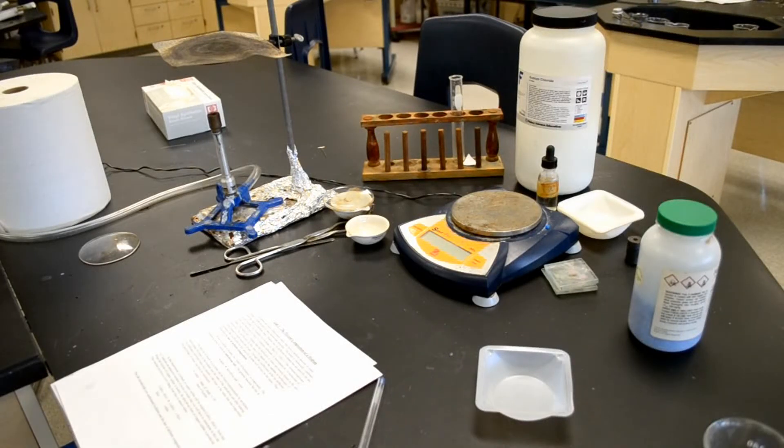Today we're going to do Lab 5, the percent composition of a hydrate.